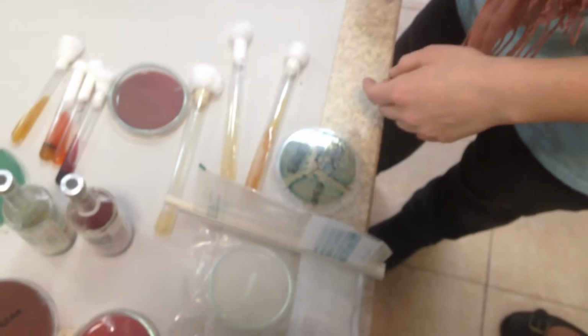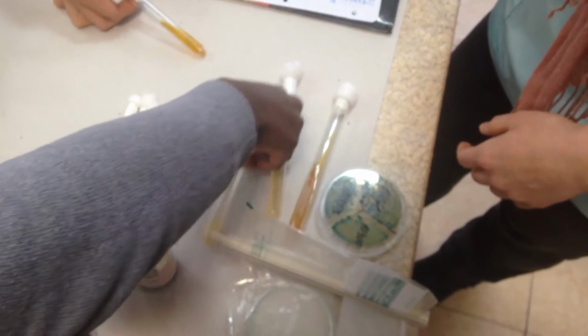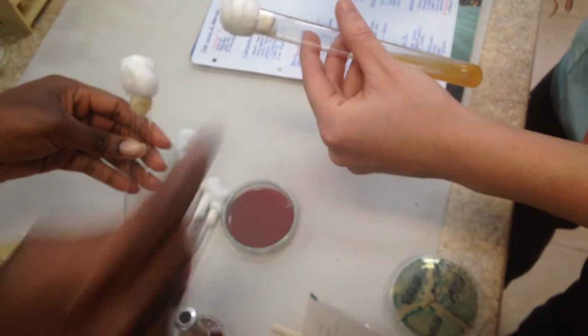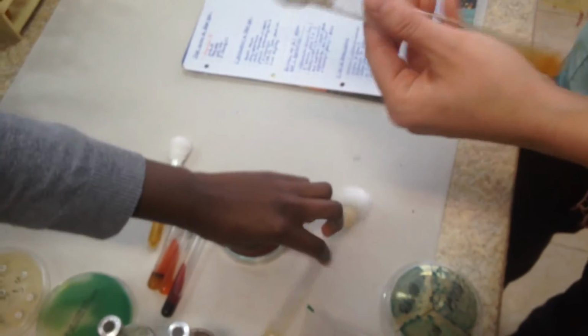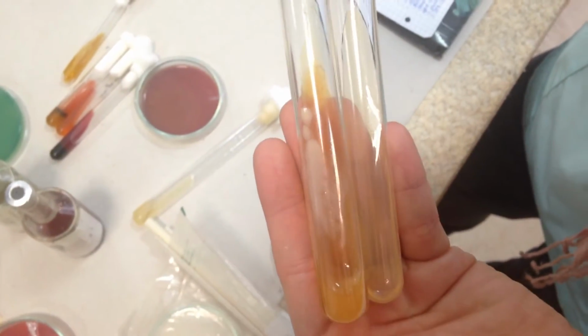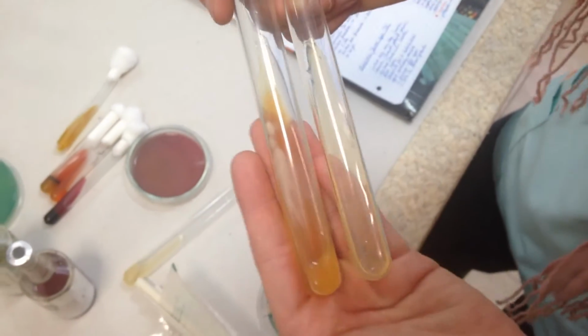Where is the Sabouraud dextrose agar? Because we were doing it in order. Yeah, this one. But there are two. One is positive. This has glucose broth. This has Candida. This is the plain one. So it depends which one you want: plain Sabouraud or Candida Sabouraud. This is positive for Candida albicans, and this is just there. Don't know that much about Sabouraud agars. Sorry for that.